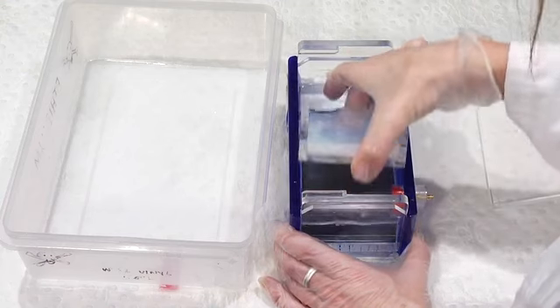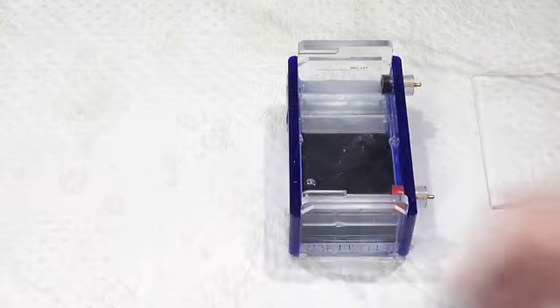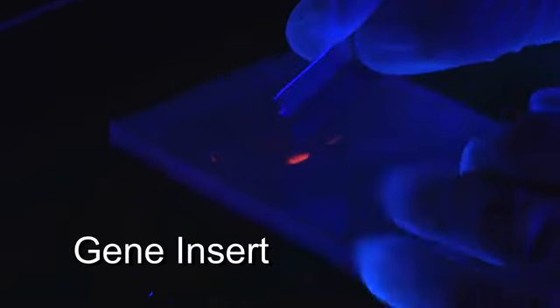We can then go and visualize these fragments under UV light. I then simply cut out the purified plasmid, and the purified gene insert.